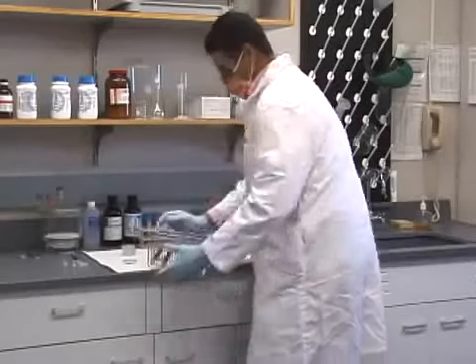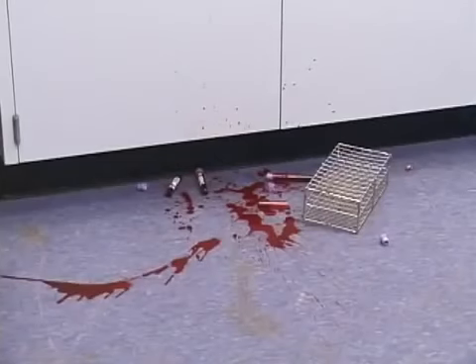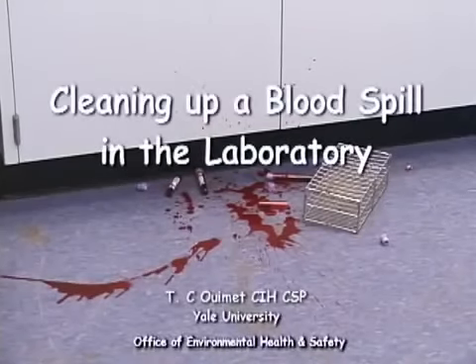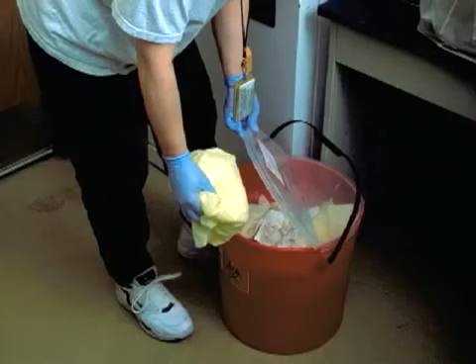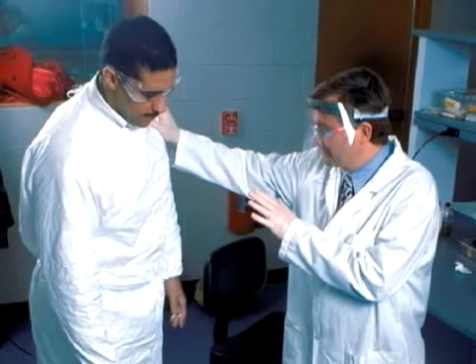Large spills of blood and other potentially infectious materials occasionally occur in laboratories and are typically cleaned up by laboratory personnel. If you should experience a spill of this type, follow the procedures described in this video. If you are splashed with infectious material during a spill, immediately remove all contaminated clothing and dispose of them as biomedical waste or autoclave them.